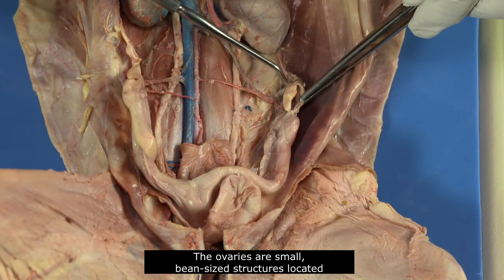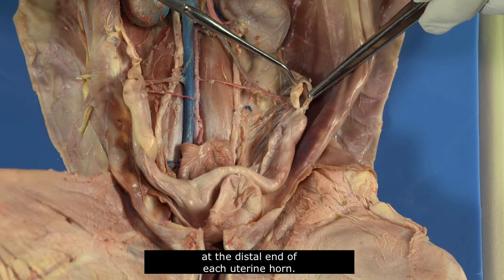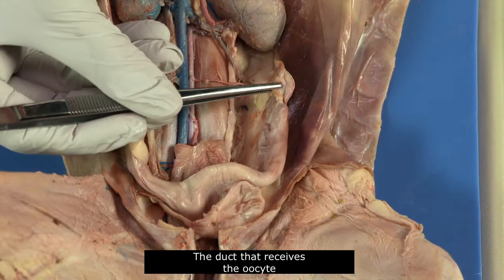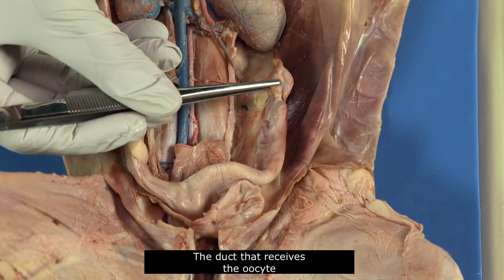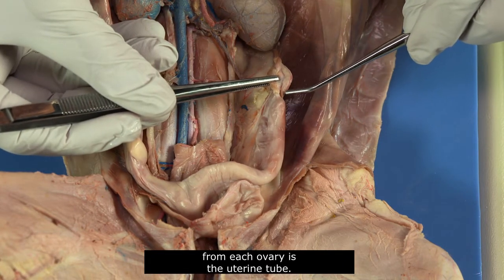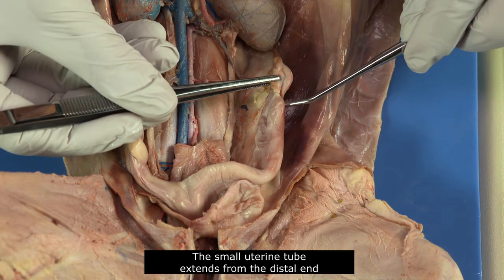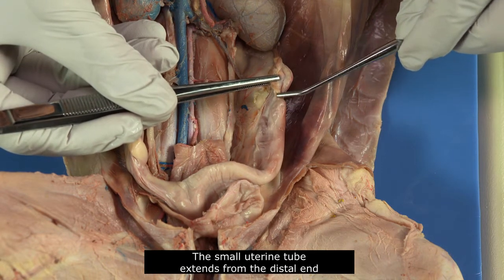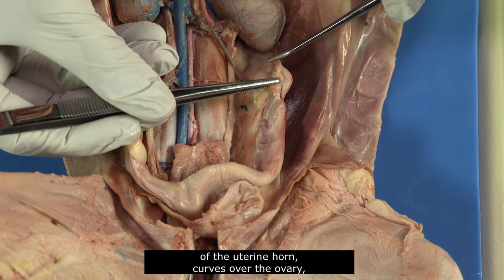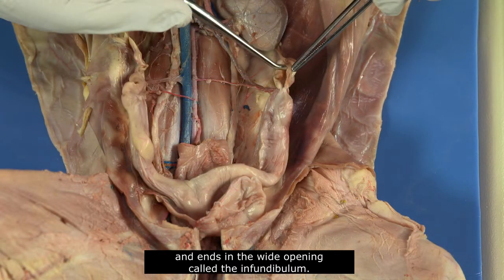The ovaries are small, bean-sized structures located at the distal end of each uterine horn. The duct that receives the oocyte from each ovary is the uterine tube. The small uterine tube extends from the distal end of the uterine horn, curves over the ovary, and ends in the wide opening called the infundibulum.